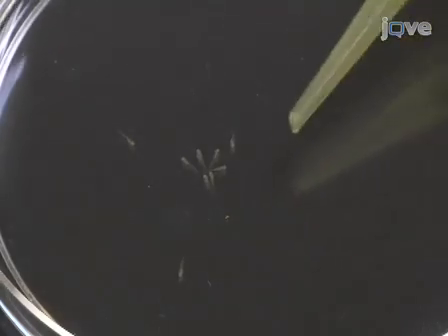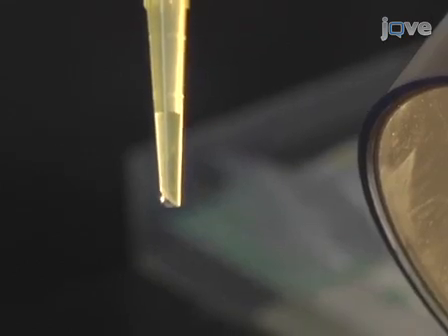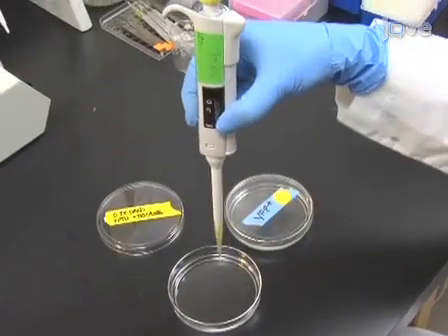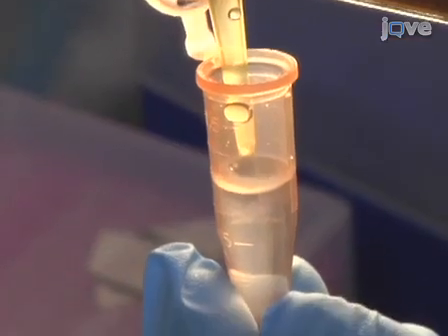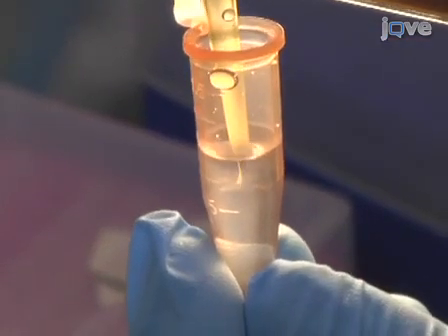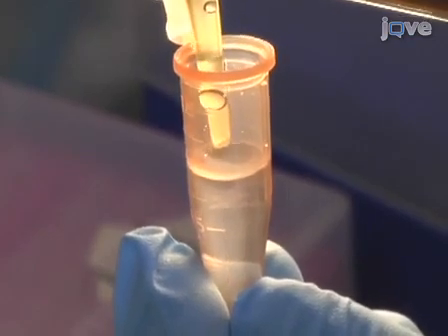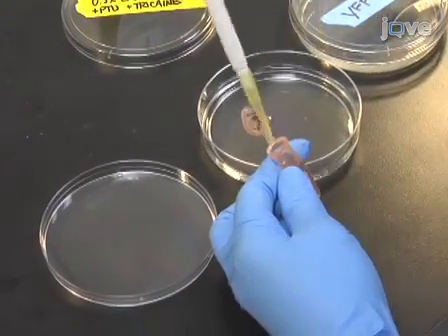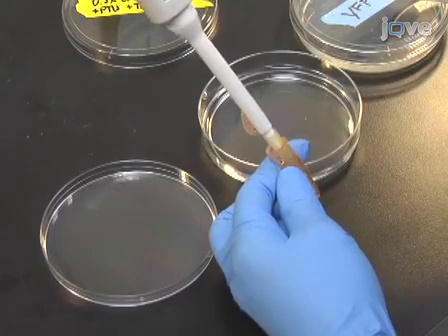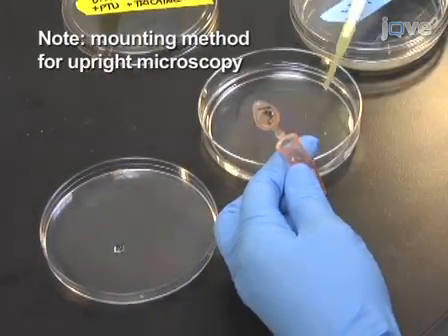Using a micropipette, draw individual fish into a trimmed pipette tip in a volume of approximately 30 microliters of anesthetic solution. Next, invert the pipette and allow the fish to settle to the bottom. Touch the tip to the mounting solution and allow them to transfer by gravity. Take care not to dilute the agarose so that it can be reused. Discard the remaining anesthetic solution from the micropipette, then, using the same tip, transfer the fish to a petri dish in about 30 microliters of mounting solution.